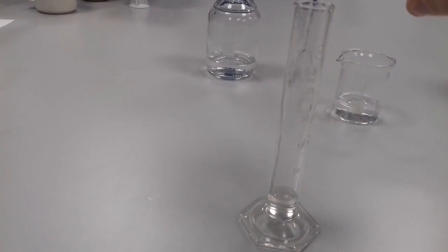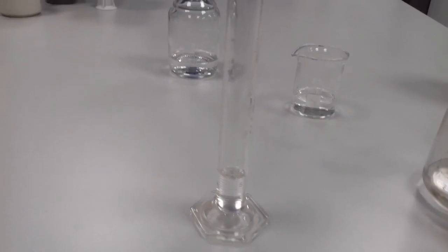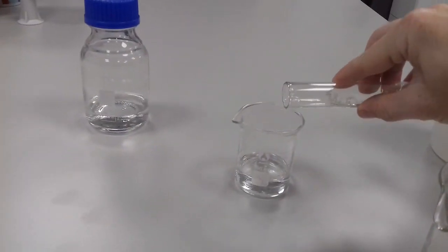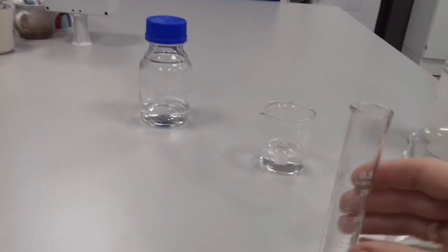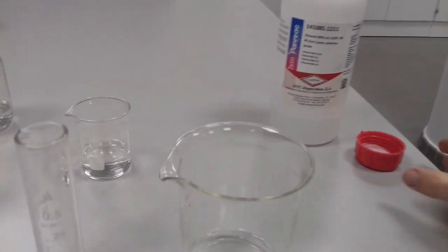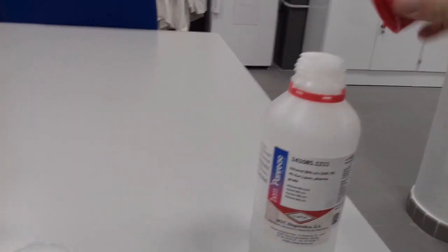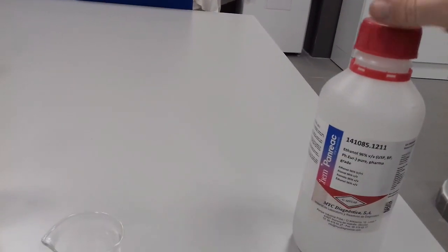In this moment, we should have already our solution in 70% alcohol. As you know, with this formula, you can have any concentration which you desire. It's so simple and you just need to follow this formula.